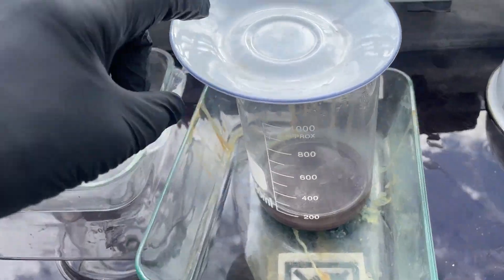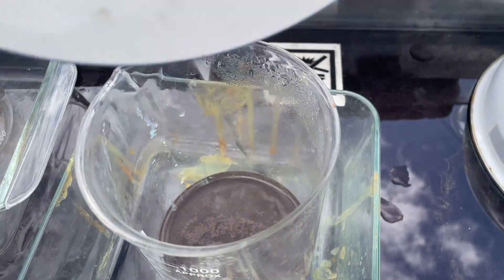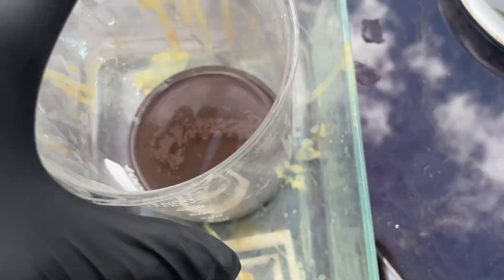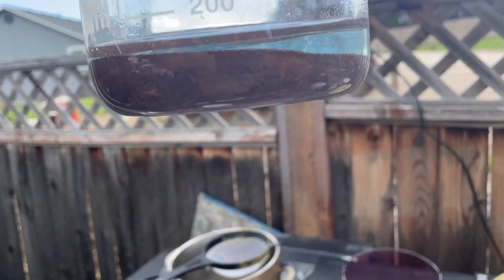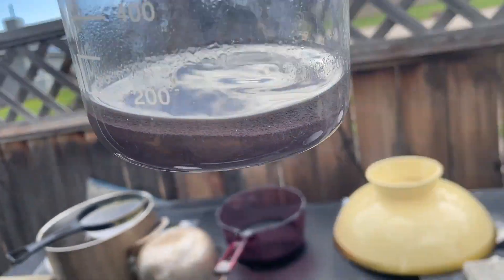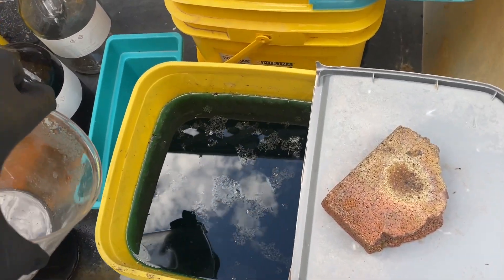Here's our silver — this thing here is metal. So that's some silver metal we can melt up. But before I do that, I'm going to combine it with this stuff here — which is just all chlorides. It's got a smidge of water sitting on there, a tiny bit of color left in that water. I washed it about three or four more times. You can see the white chlorides underneath — that material that's been exposed to the sun is already oxidizing.